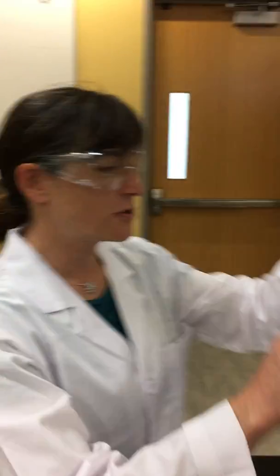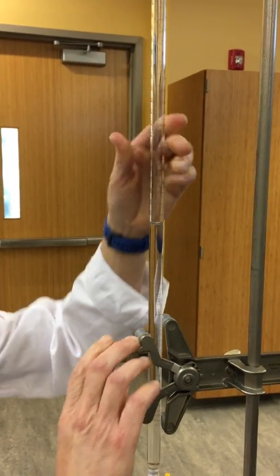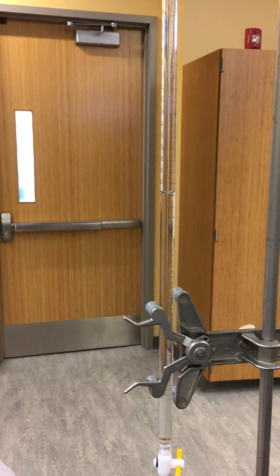So now what we need to do is record the final volume of sodium hydroxide. I have to raise this up to my eye level. And our final volume is 30.90 milliliters.